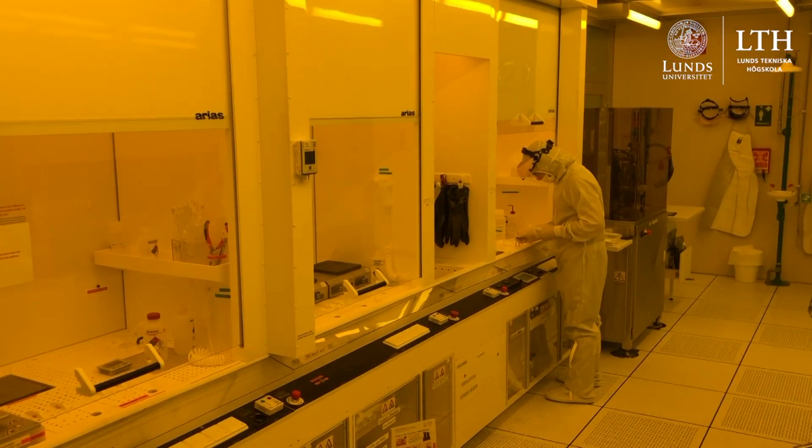By consecutive use of thin film deposition, patterning and removal of materials, you can build up a 3-dimensional device that can be used for your research. Examples of these are in micro and nanoelectronics, semiconductor research, or microfluidic devices for biophysics. Lund Nanolab is staffed by research and process engineers with specific expertise on the equipment within this lab, so the users can get trained on the specific use of the equipment here.